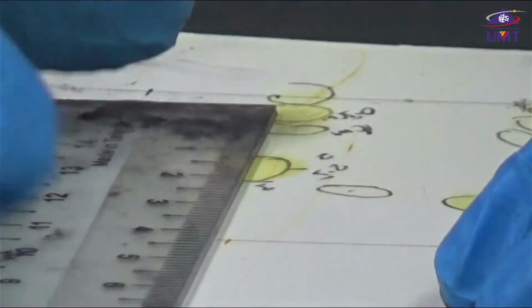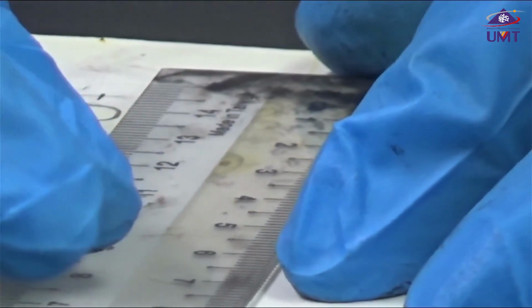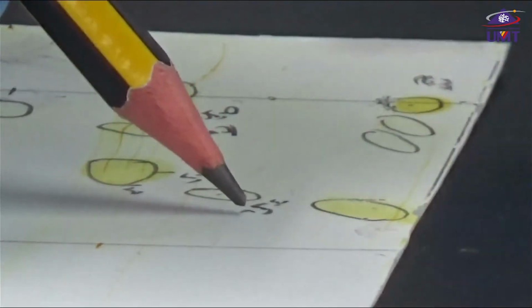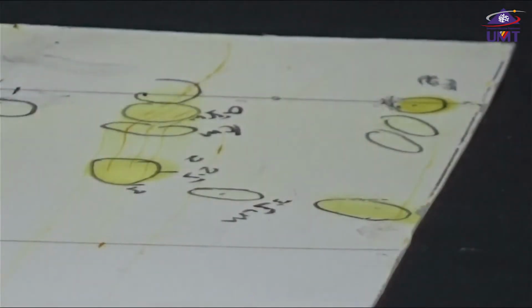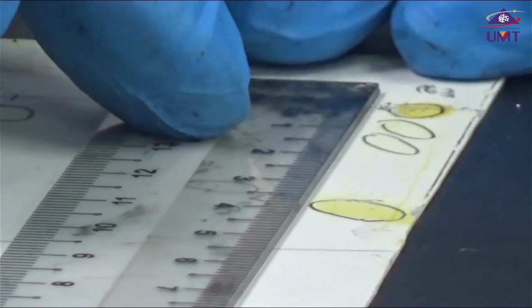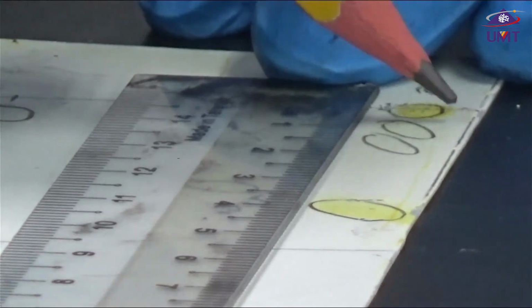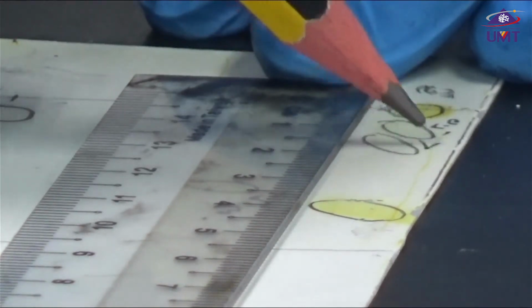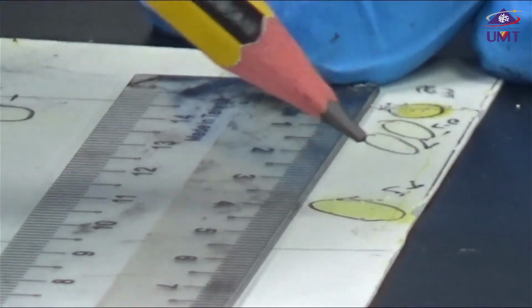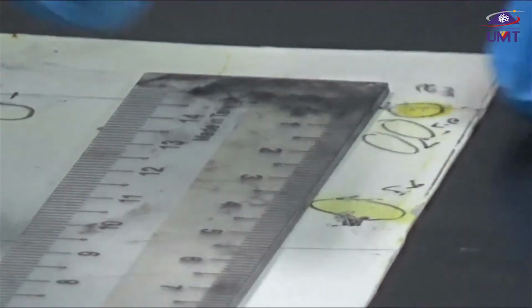While for our eggs, for our milk, we have around 3.5 centimeter, and then for our last sample, the first band here we have 0.5, 1 centimeter, and then the band starting at 3.5 up until 4 centimeter.